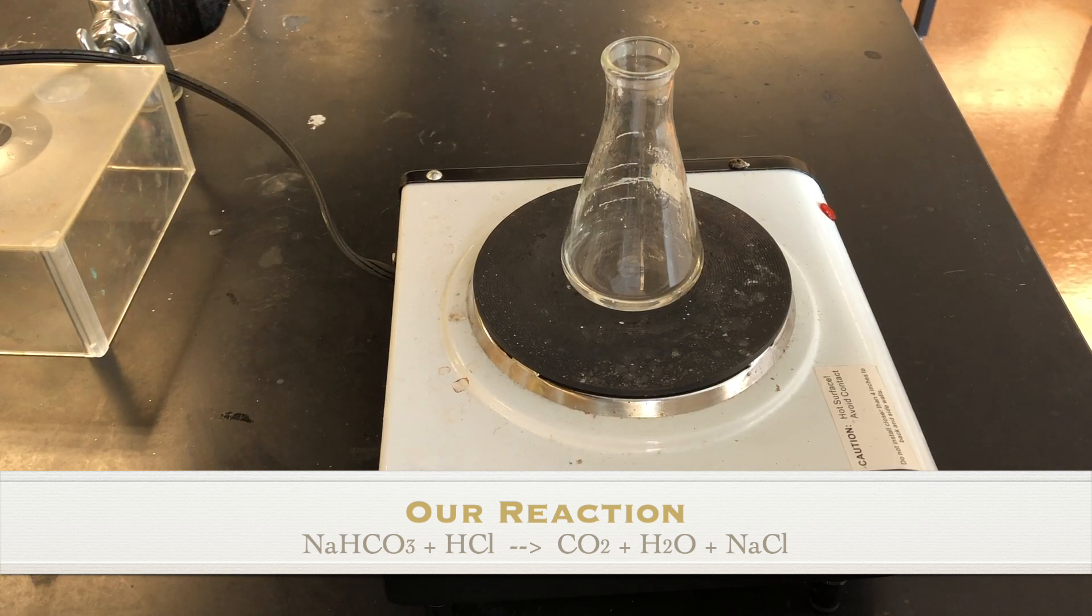The carbon dioxide is gone, escaped during the reaction. We could see that. And now we have the water and the sodium chloride left. So we will simply boil away the water, which should leave us with the sodium chloride.